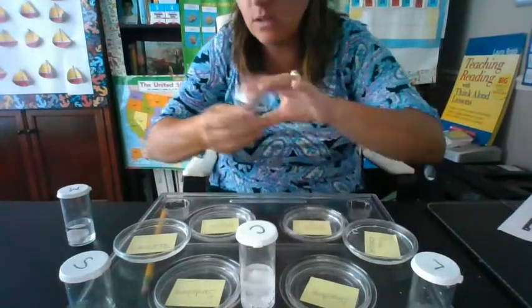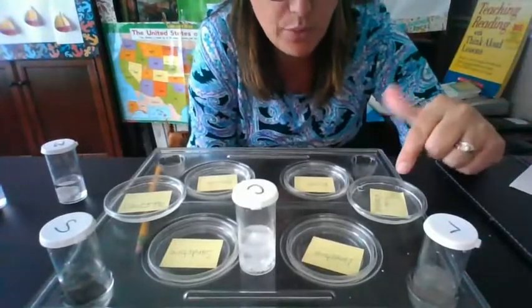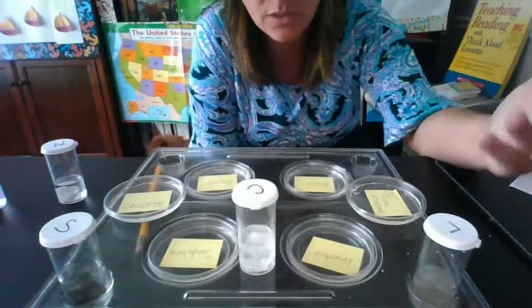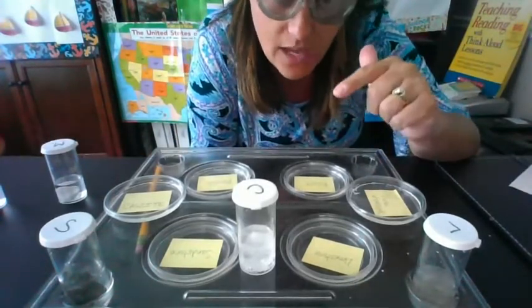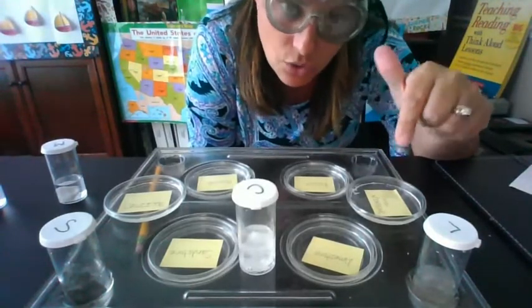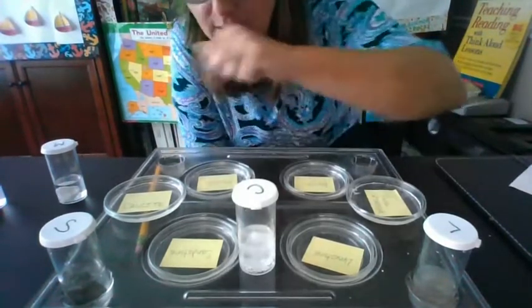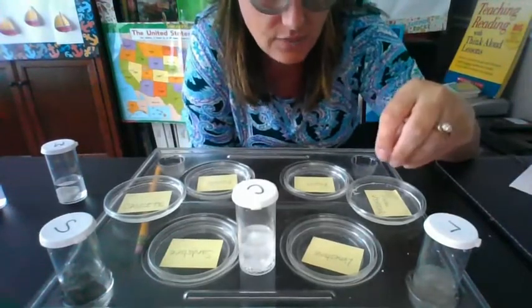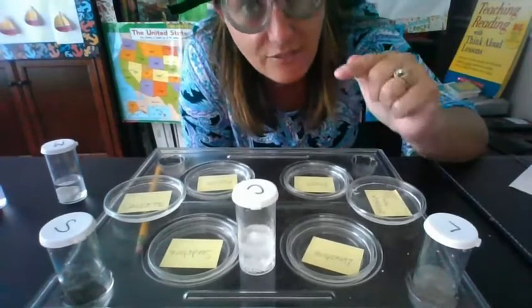Perfect. All right, my friends, it's important for me to point out, we have our pure vinegar here. So if any of these samples of rocks do not have calcite in them, then what you see that has evaporated is going to look very similar to the pure vinegar. The samples that actually have calcite in them, because it was mixed with the vinegar, are going to have some pure vinegar crystal there, but also calcite crystals.